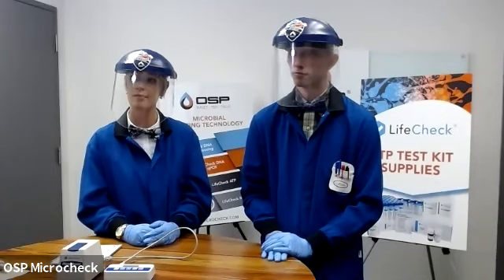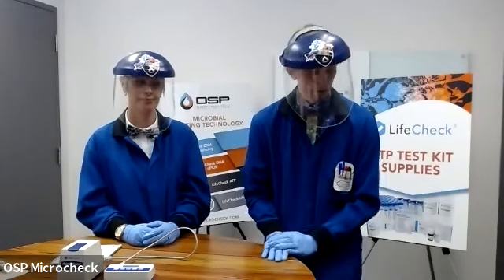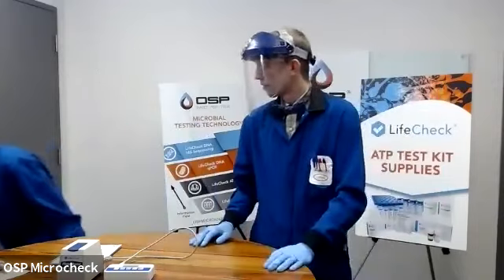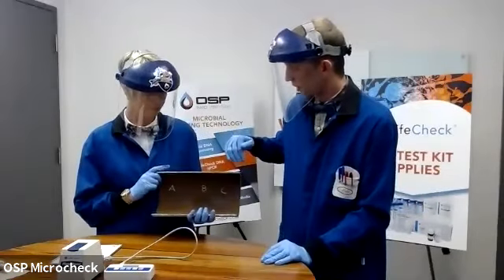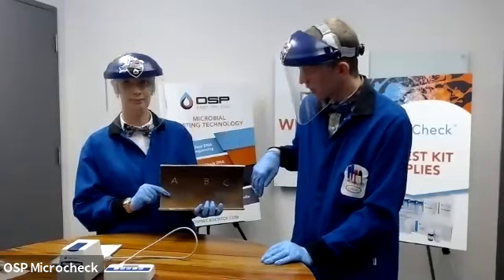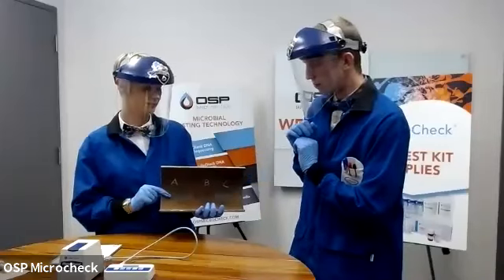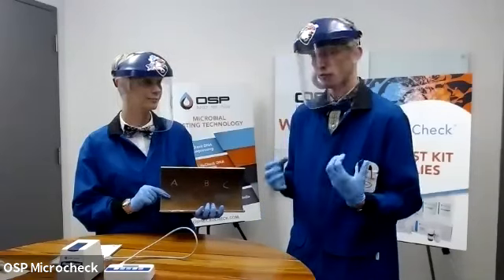With regards to surface swab and solids testing, what sample preparation is recommended? So surface swab testing, sample preparation, I'm going to say as little as possible. In this example here, we had a pipeline cutout. Somebody had to take some sort of cutting tool, a grinder, and actually section this pipe. So there's going to be heat involved with that, handling involved with the sample. You definitely want to try to protect the surface that you are sampling from any outside forces as much as possible.